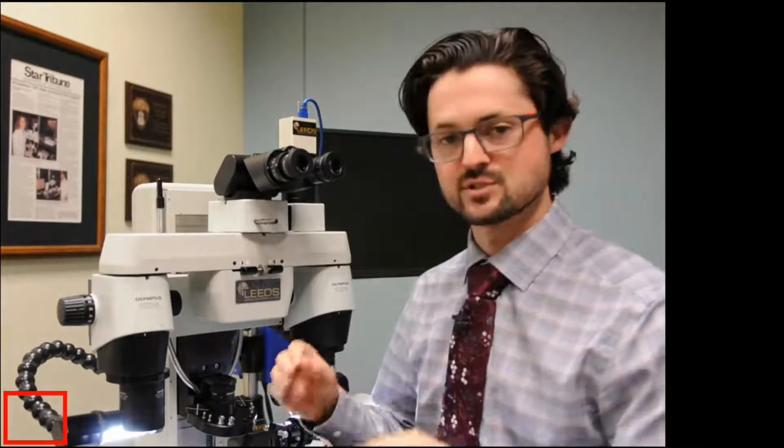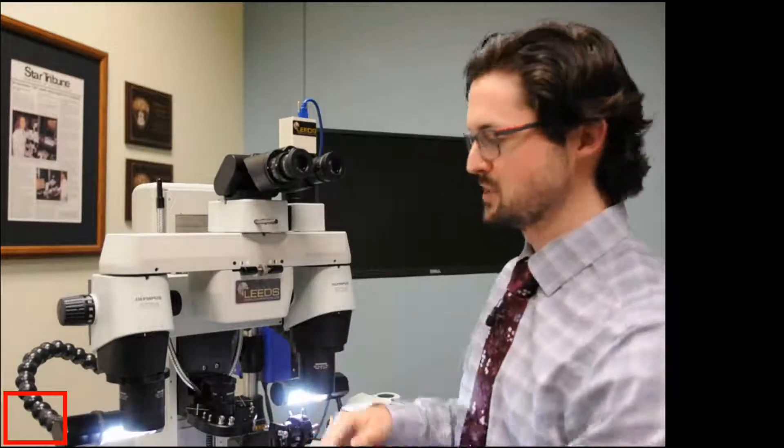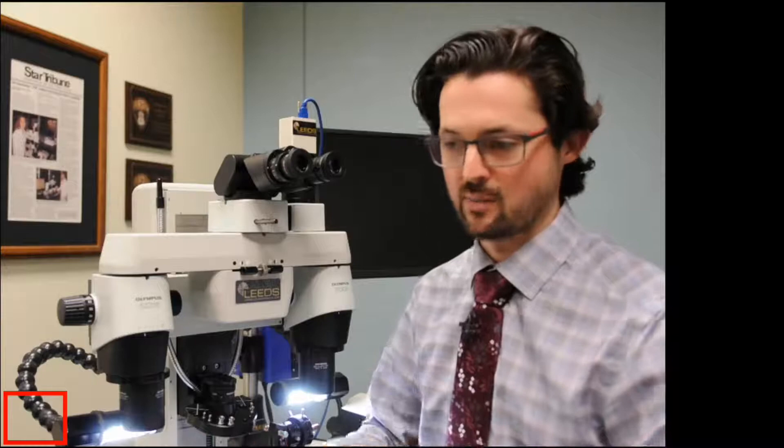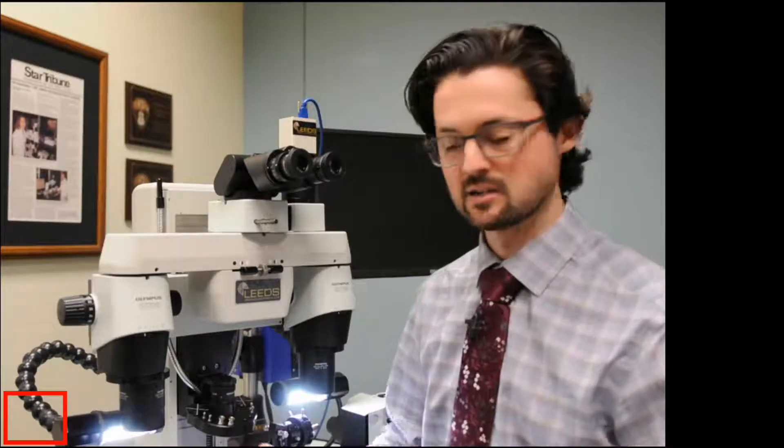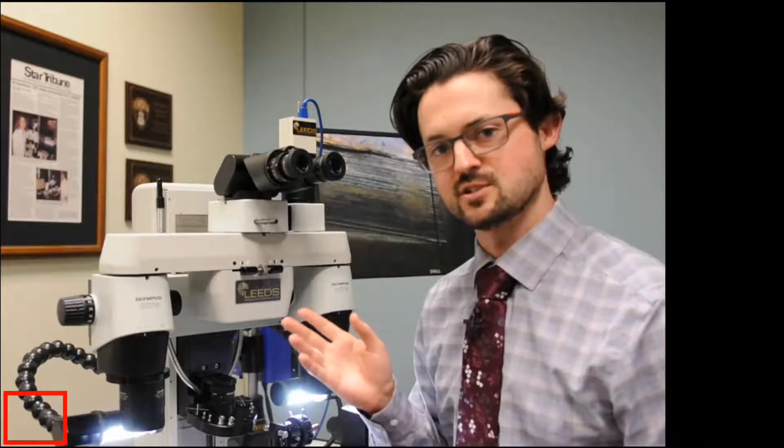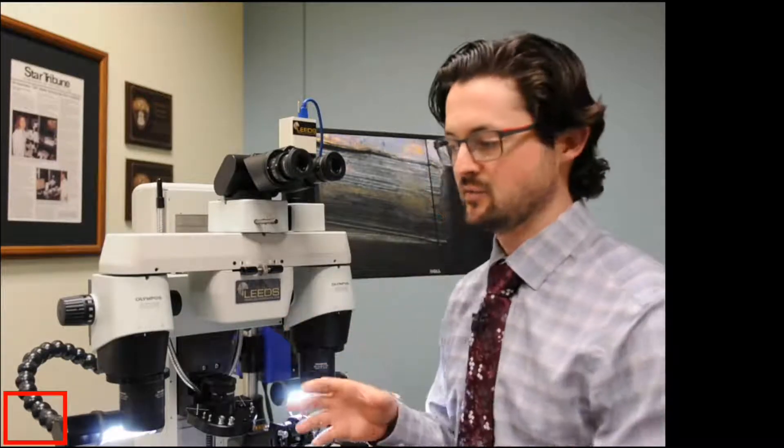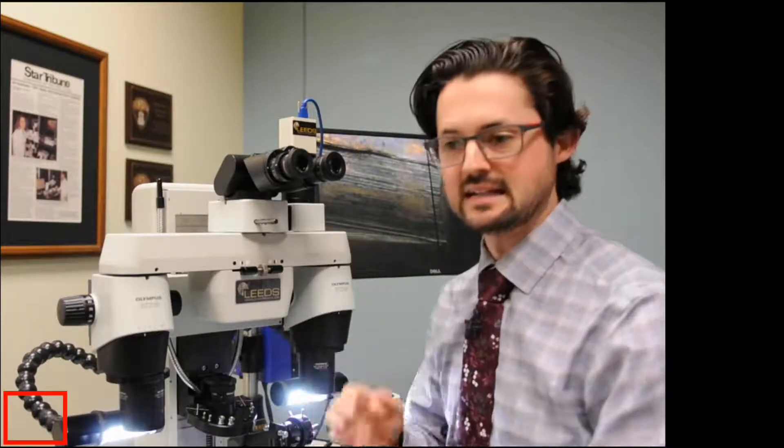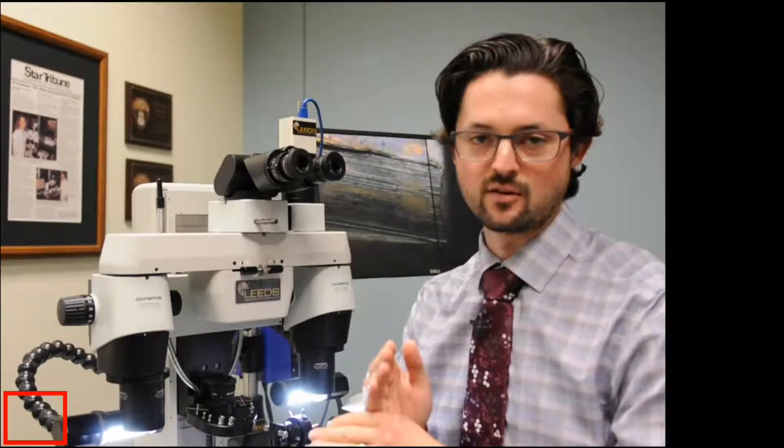And when you have those numbers set, what will happen is when you zoom in and when you zoom out, the image will remain in focus. When you go high power, focus, go to low power, it will remain in focus. Additionally, the crosshair, if you have a crosshair loaded into the microscope, if you know the exact number of your prescription, you can dial that in, and then that crosshair will remain in focus.